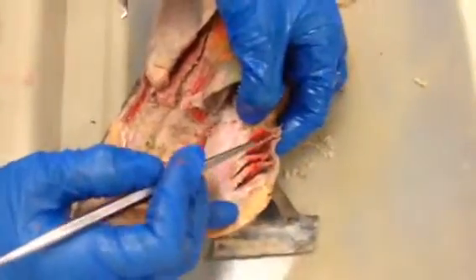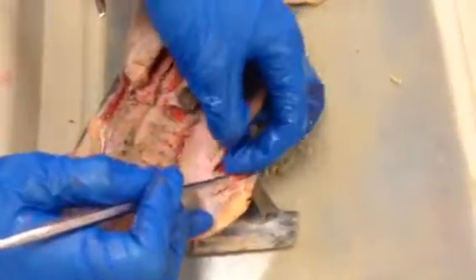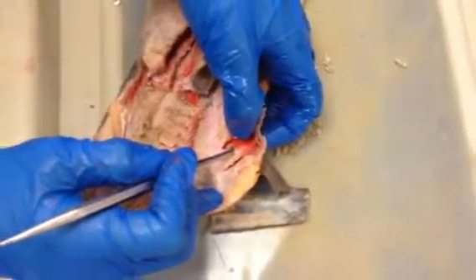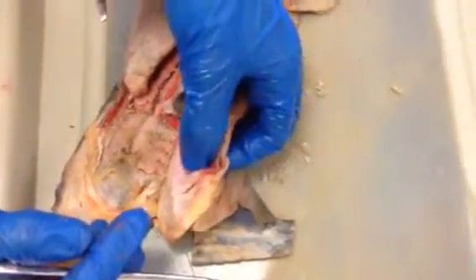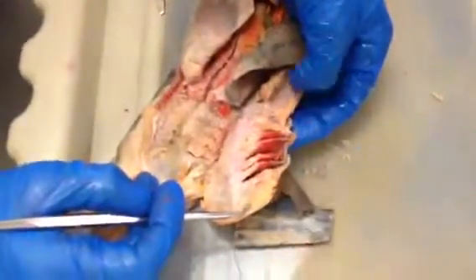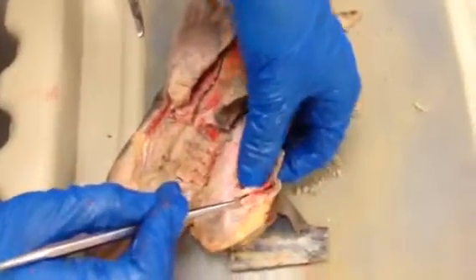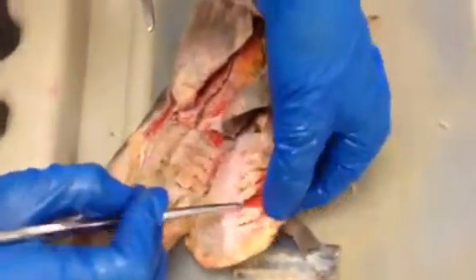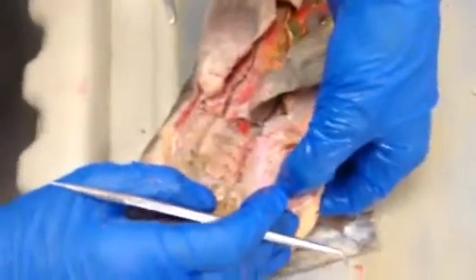Okay. Can you point out the artery? Huh? That supplies. Which artery? Oh, was it epibranchial artery? Afferent branchial? I have to look in the book. Afferent, and you have the epibranchial. The one that's around the ceratobranchial is the afferent, I think. Right, so these are afferent branchial arteries. Can you show me in the book? Because I don't remember that.